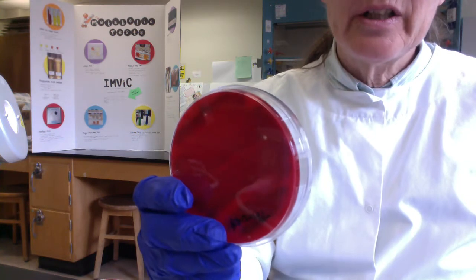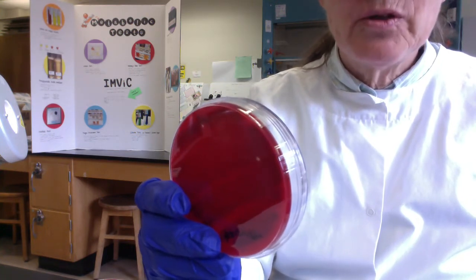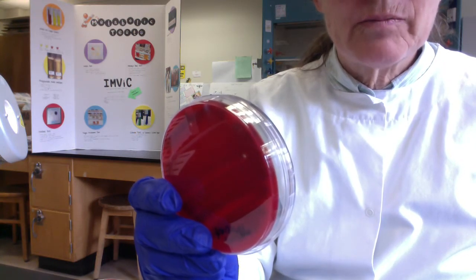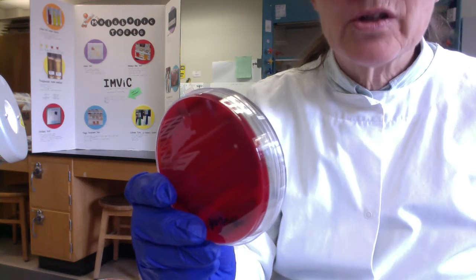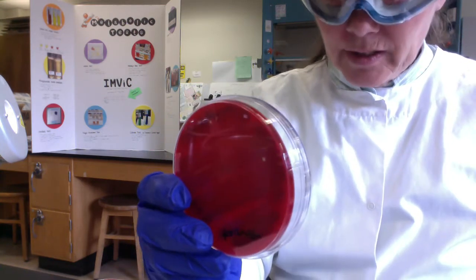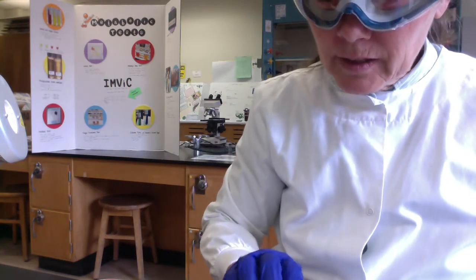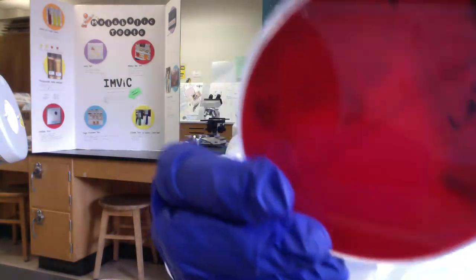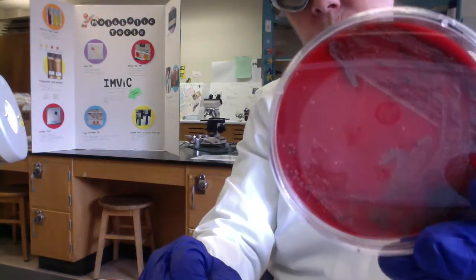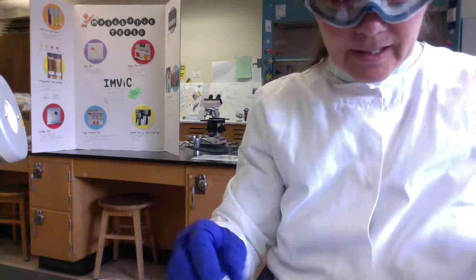Okay, so again, the greenish discoloration, folks, that's the alpha hemolysis, probably from Streptococcus mutans. Another pathogen, another member of the genus Streptococcus is Streptococcus pneumoniae, which causes pneumonia, and that too would cause the alpha hemolysis, the greenish discoloration. So you guys, most of these plates are going to be really repetitive. This is just another one of my throat where I tried to get some isolated colonies, and again we can see the greenish discoloration, the alpha hemolysis.